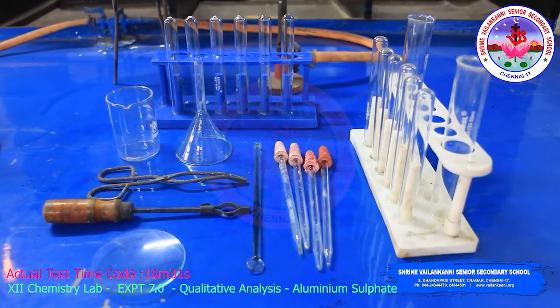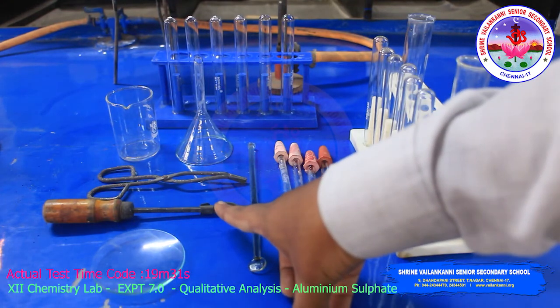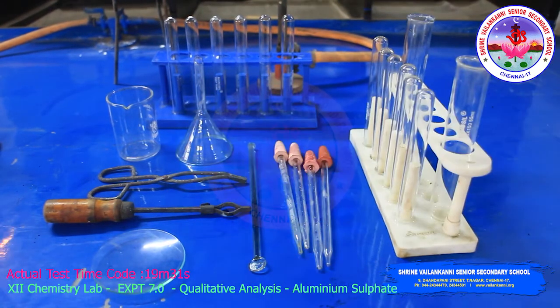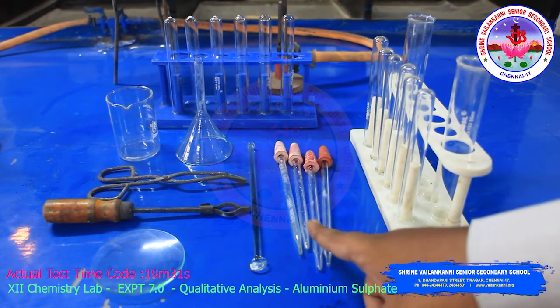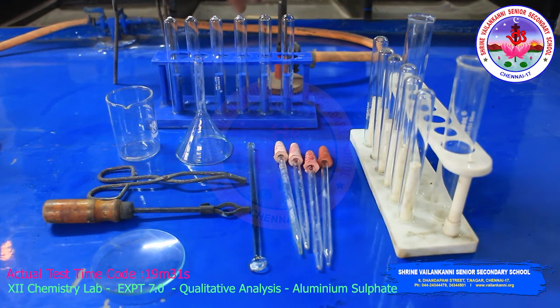Now we will do the experiment, students. Before that I will show you the apparatus for the salt analysis. This is a watch glass, this is a test tube holder, tongs, then glass rod, dropper, beaker, funnel.